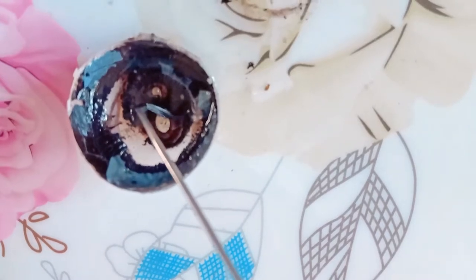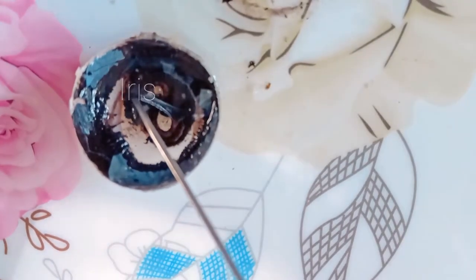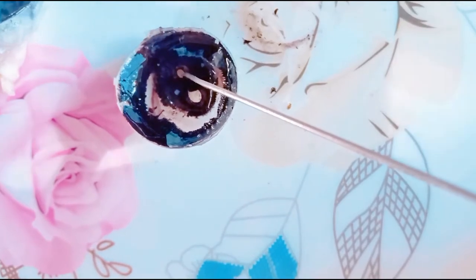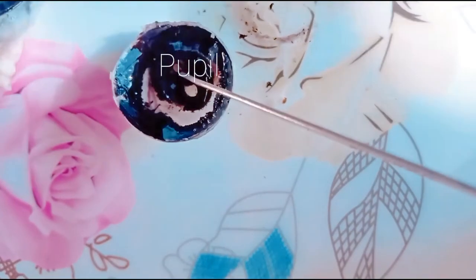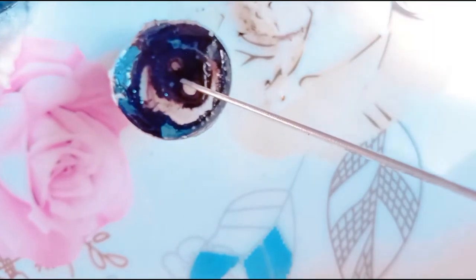Look — this lens is crystalline, solid, and bi-convex. This is the iris, found at the front part of the choroid. It has a hole at the center. This hole is called the pupil. The pupil allows light to pass into the eye.